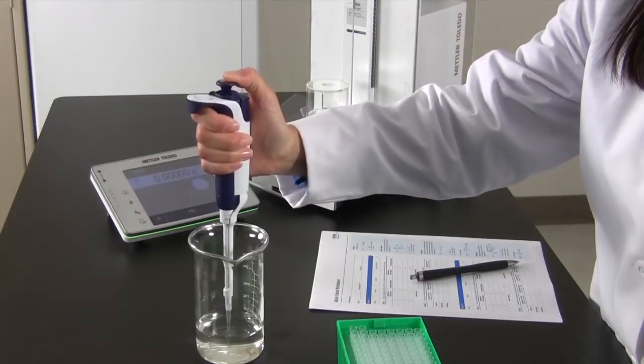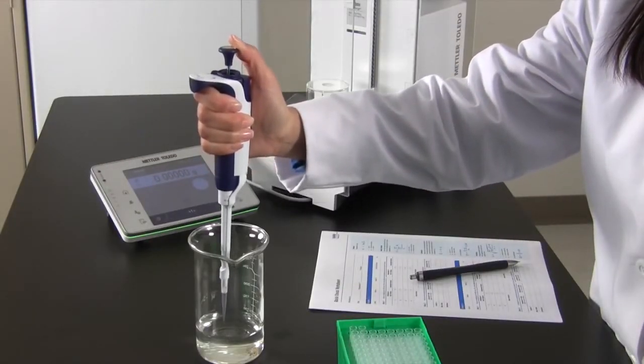Next, pre-rinse the tip by aspirating and dispensing the deionized water three times.